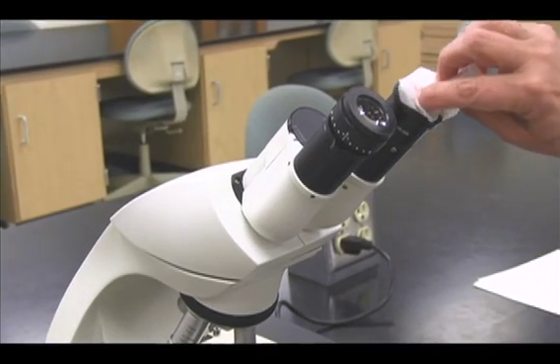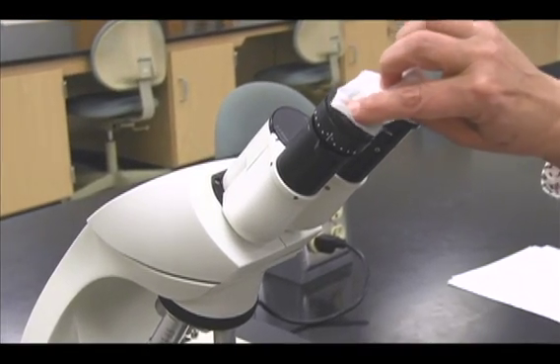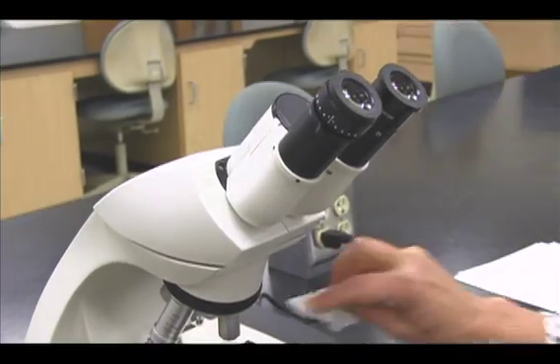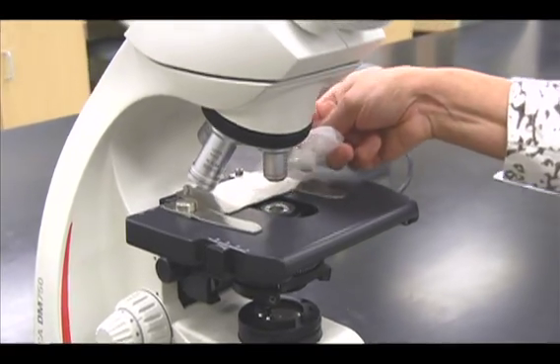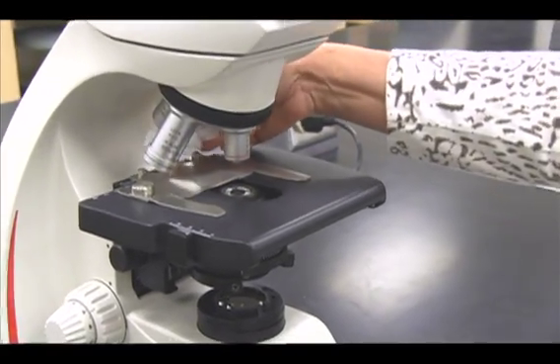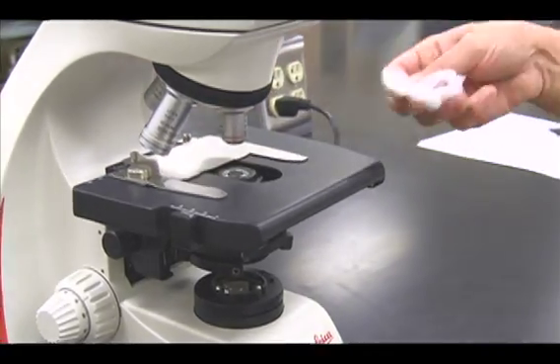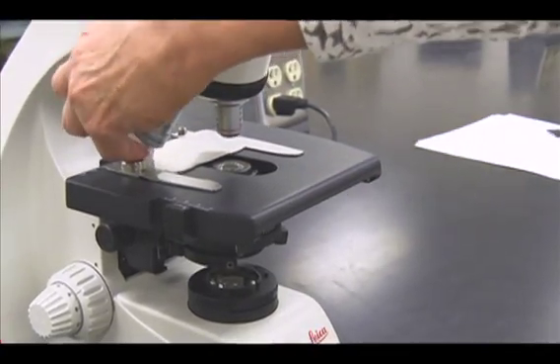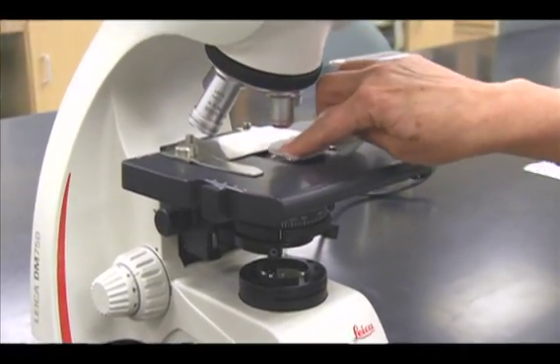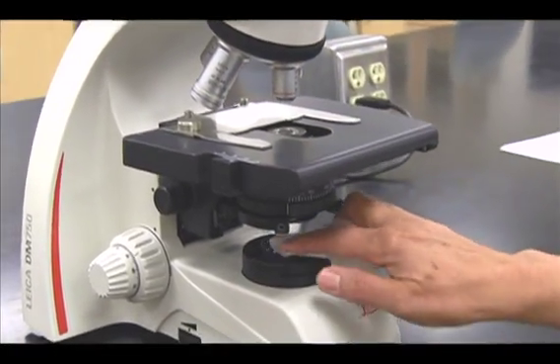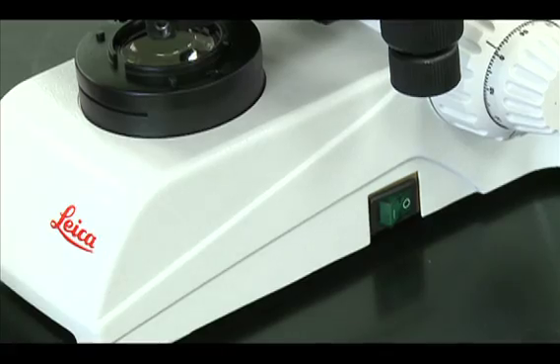Clean the oculars, objectives, condenser, and illuminator with lens paper. Switch on the power.